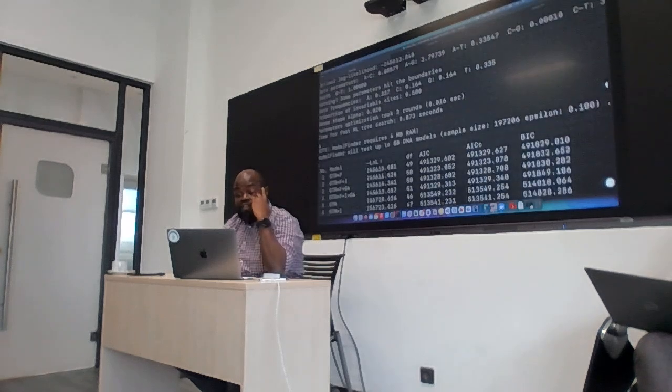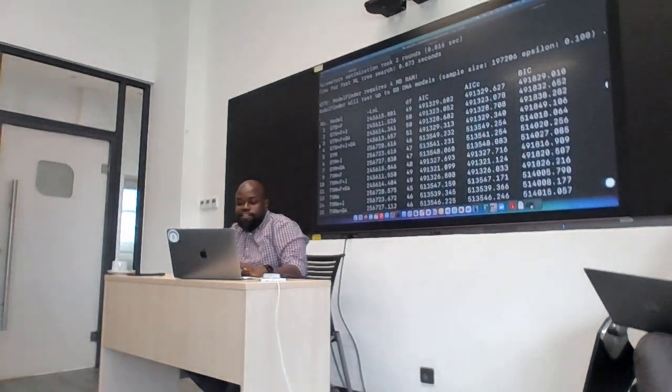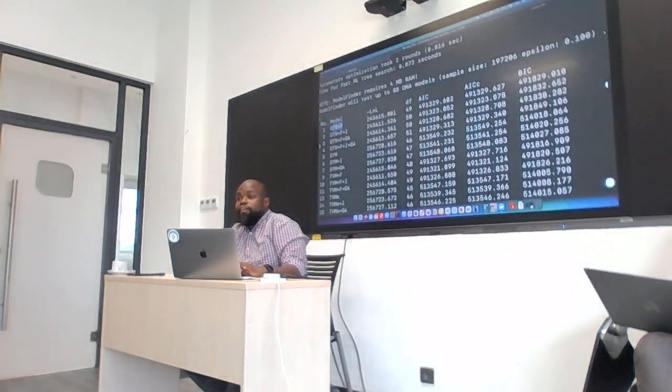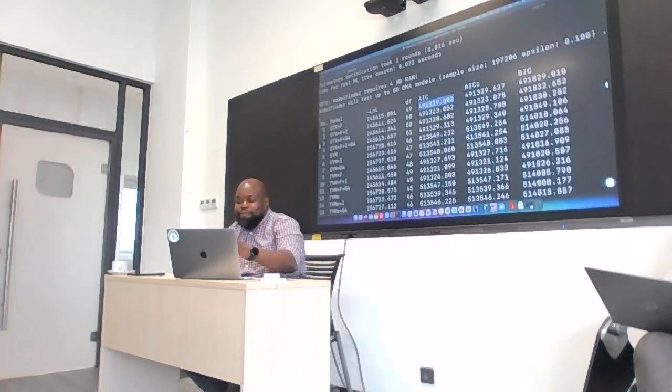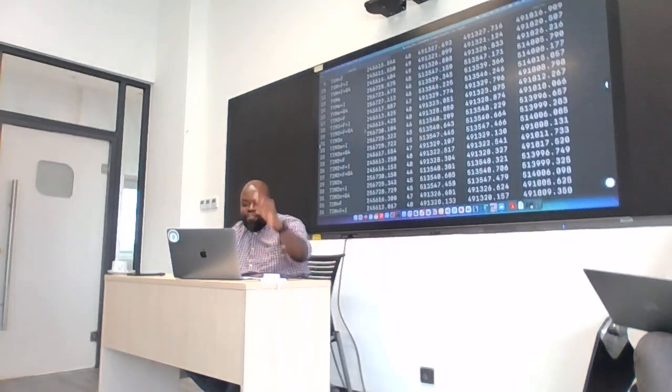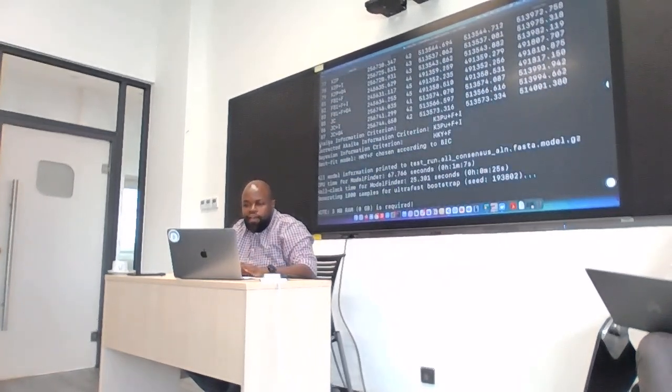The other thing that we said was to test different models and pick the best. So here you can see that it's testing model number 1, giving the likelihood, right? And also doing this Akaike information criterion with the correction and also the Bayesian information criterion. So it's giving these metrics, assessing each model and giving an assessment score. Okay? Stanislas is a statistician. He knows much better about these things than I do. So you can see that it's testing about 87 models. Okay? Then at the bottom here, based on the AIC, the best model is Kimura 3 parameter plus F plus I.